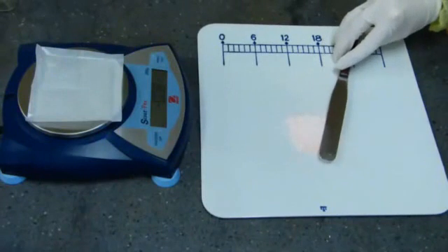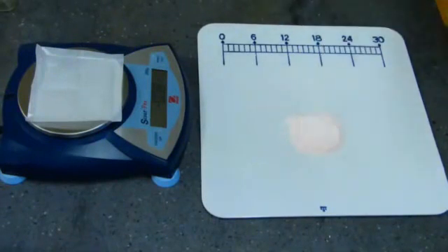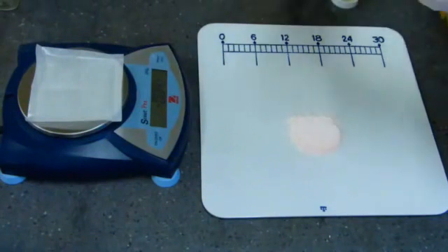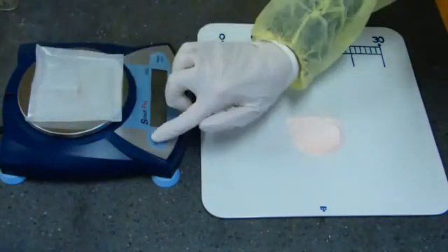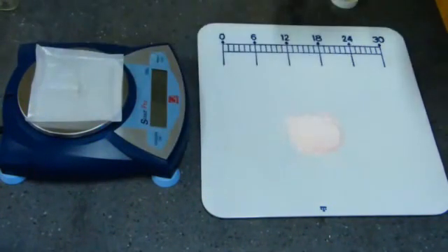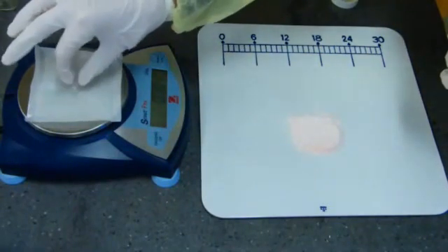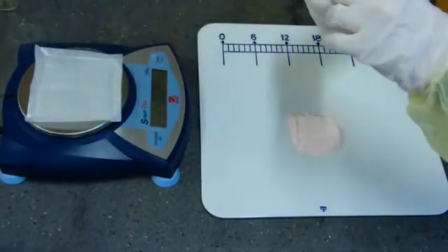Weigh paper must always be used on the balance pan. Place an empty capsule of the same size that was used for punching on the electronic balance pan. Then tare or zero the balance to cancel out the weight of the gelatin shell and the weigh paper. Be sure to remove the capsule shell after zeroing the balance. The balance should read a negative number.